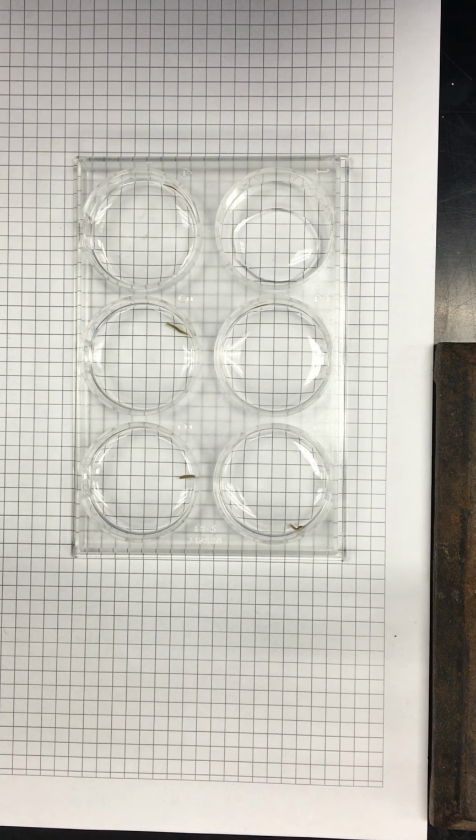So essentially, we're just going to add slightly less, like 20 microliters to your 2 mils. So it'll be a small amount. Even if it's over a little, it's not going to change the volume that much. All right, you guys ready? I need to keep that consistent. Micro to milli is 1,000.